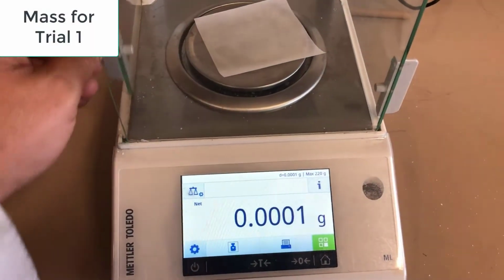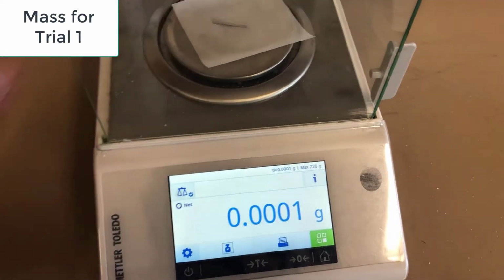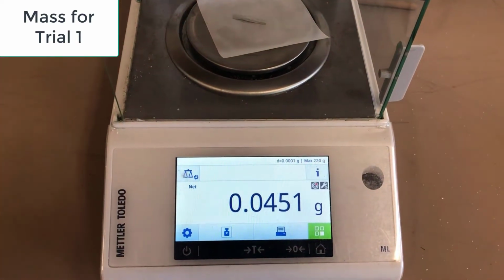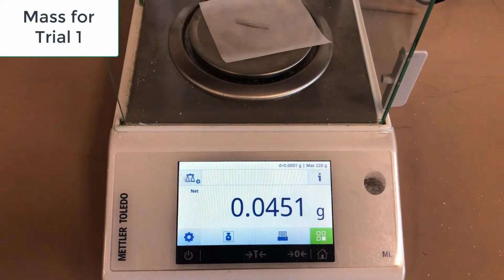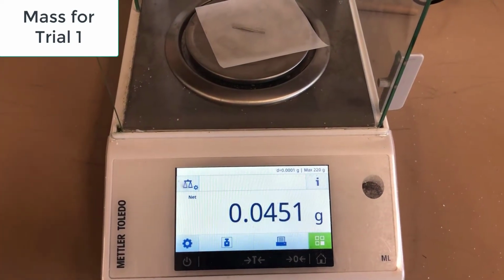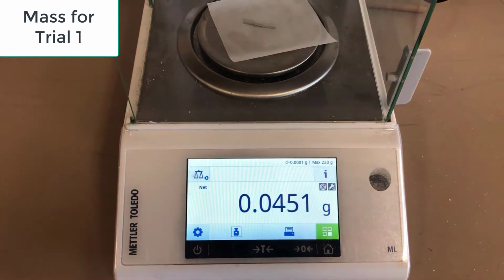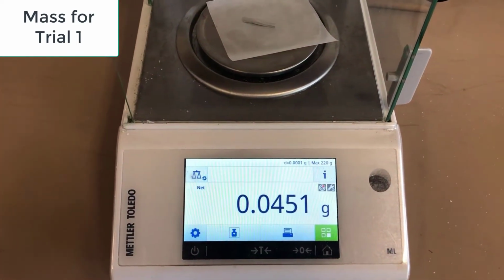So I've tared out the balance and I have my magnesium strip, so I'll go ahead and place that on there, and you should write those digits down. The place to write this down is for trial 1 on the last page of the report sheets.